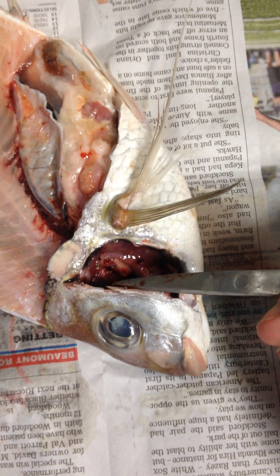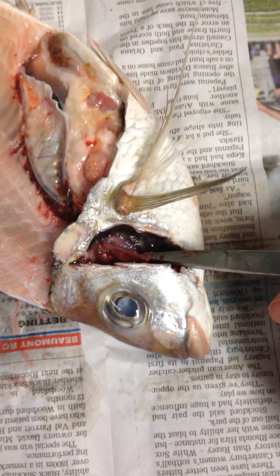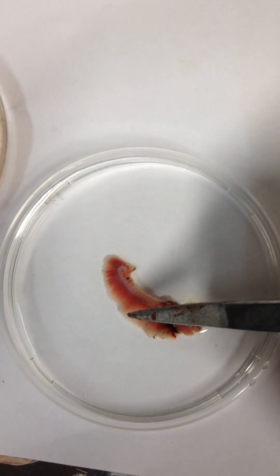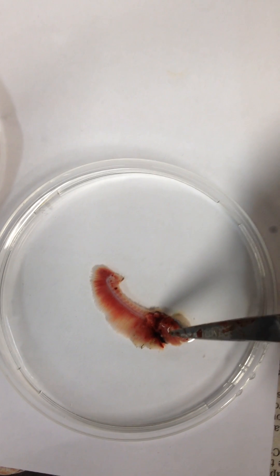We've already cut that out and you can see that the gill arches are inside. We cut some gill arches out and then we floated a gill arch in some water, and you can see that the gill arch runs down here and the gill filaments run off here.